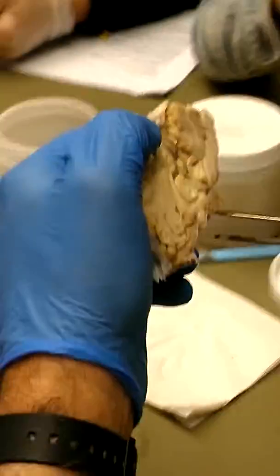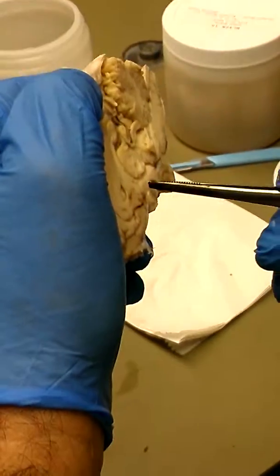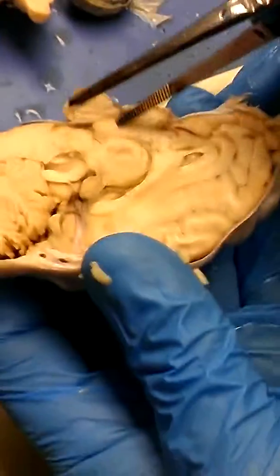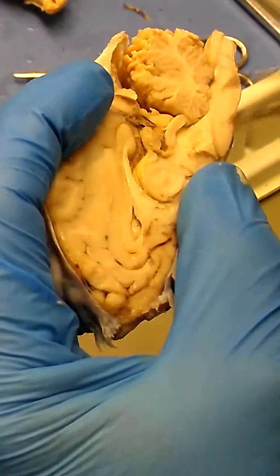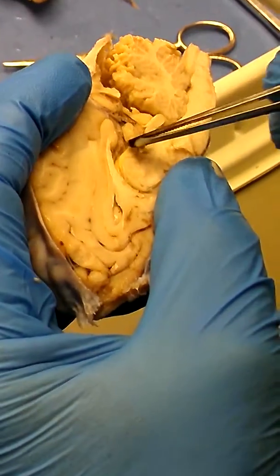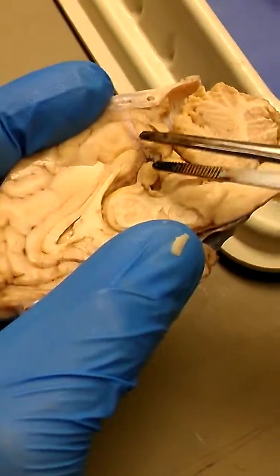You'll notice the anterior pituitary is up all by itself. It's not connected to the brain. The posterior connects to this region right here. That's the hypothalamus. And then where's the thalamus? Right there. Thalamus, hypothalamus. Right above the thalamus, not below, this was the third ventricle. That's the choroid plexus right there. Okay, there is a structure which was ripped off on that half, but it's right here. This structure right here, that's the epithalamus, but it's the pineal gland. So there it is. That's the pineal right there.